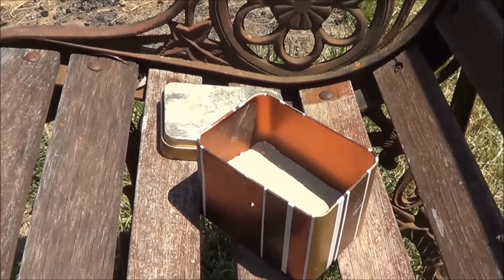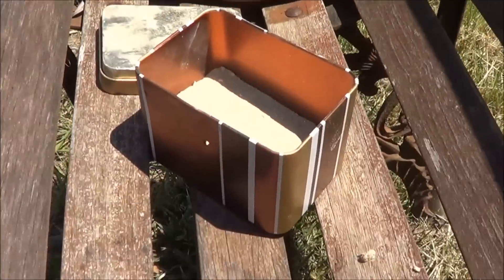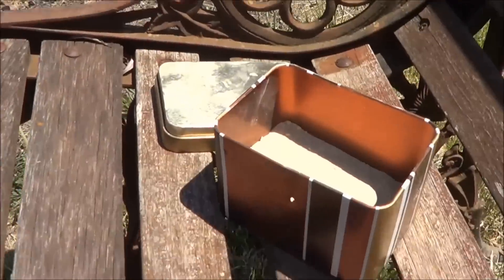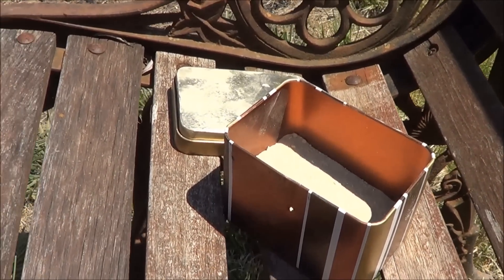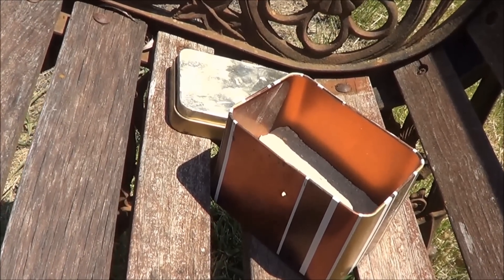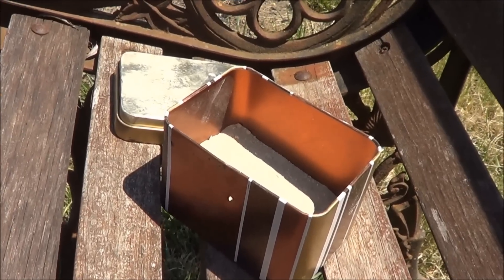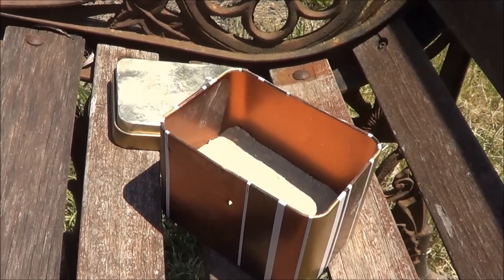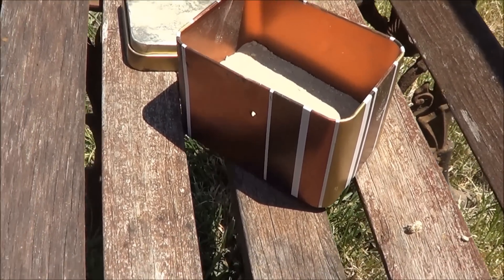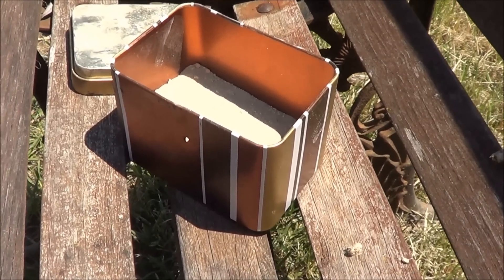I don't feel like building an electric furnace. So what I'm going to do — I've got this huge pile of wood here, and that is going to be a bonfire tomorrow night, and I am going to put this in the fire. I've done this previously in that little household fire that we ran, and I couldn't get it up to about 800 degrees, but I found that the reaction happened basically past the melting point of aluminium — so that's a bit shy of 700. My propane burners won't probably get to 600, 600 at a push.